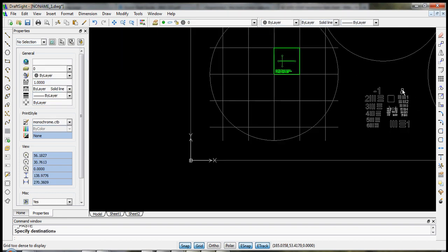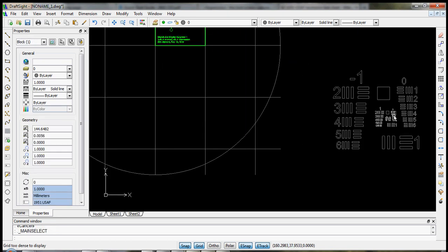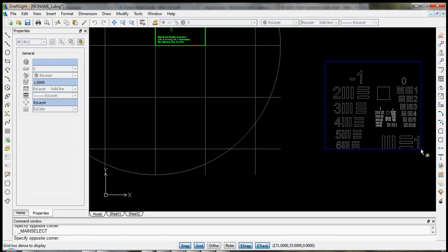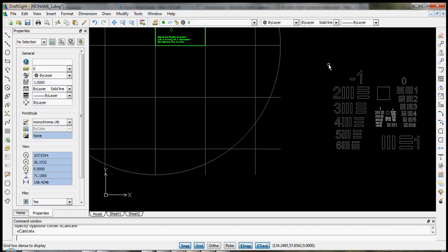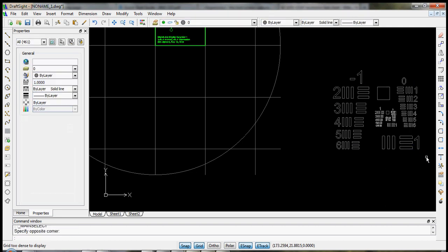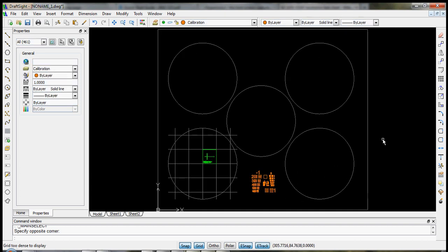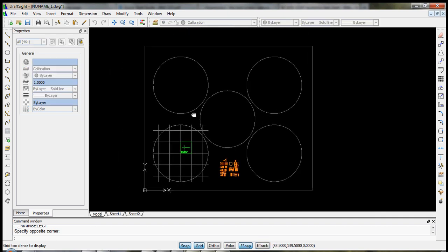Alright. And let's explode the block. Let's select all these pieces. And let's move it to our calibration layer. Okay. And there we go. We've got our calibration pattern. We've got our feature. And in principle, this mask is ready to go.